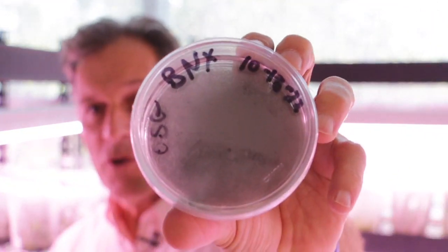Okay, here's another one. This is a Brassavola nodosa cross, and this was a capsule that a colleague gave me. It's a wide cross, so it was a really unusual cross, and he was excited, and the capsule got to the right point, and then it started turning yellow about the right time, so it was perfect. I plated only a third of the seed. Opening the capsule it didn't look great, and I plated about a third of the seed, which means probably, I would guess, about 50 to 100,000 seed. And they didn't look good. I did a quick look under the dissecting microscope, and I didn't see really any embryos in the seed.